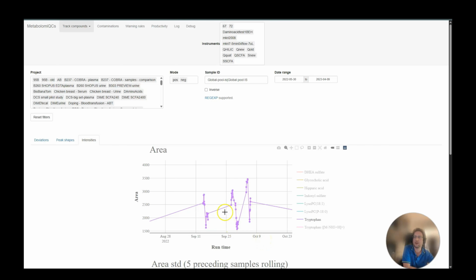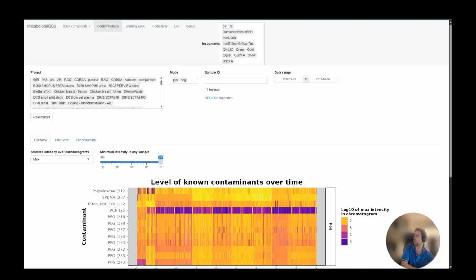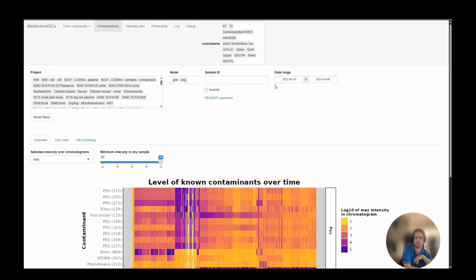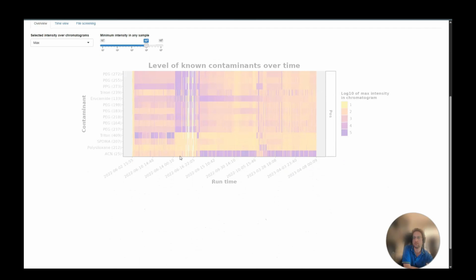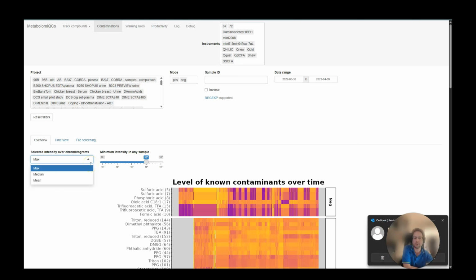Let's move on from this sad story and check the contaminations tab. We can also go a bit deeper and decrease the threshold for which contaminants we want to include. You can also set if you want to look at the mean intensity or the max intensity. Max is good for contaminants that behave like a peak, while mean or median might be better for contaminants that have a constant presence. So it's like a crime scene investigator for your LCMS.